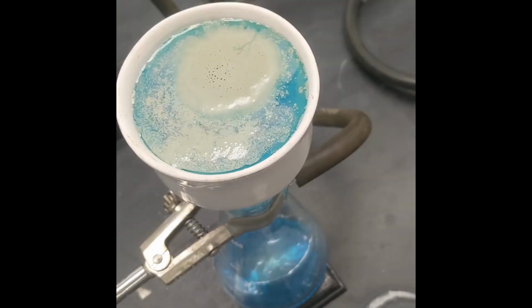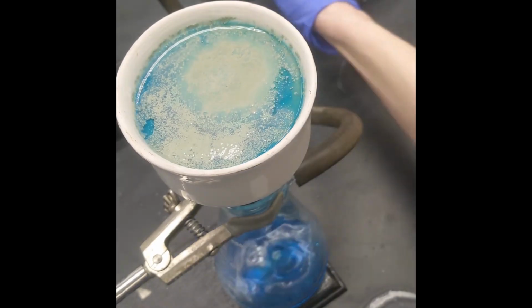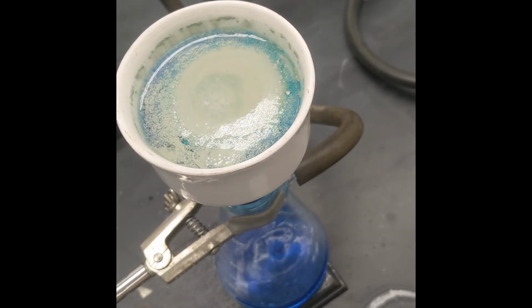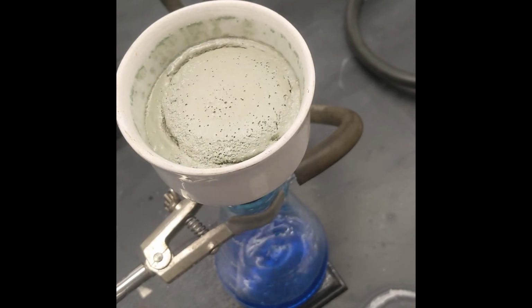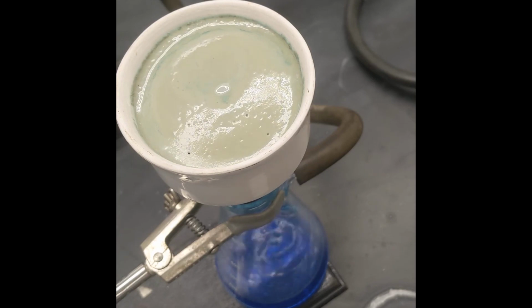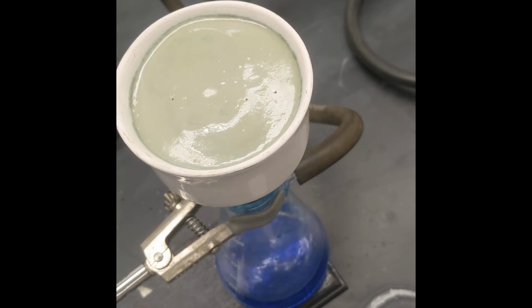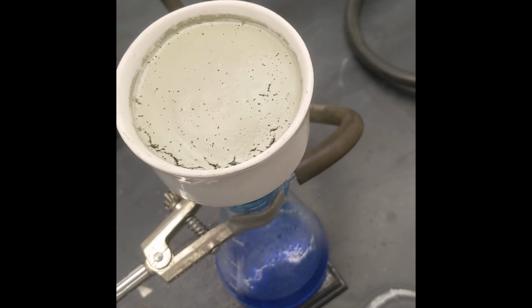I don't know how pleasant this stuff looks to work with, but it's not very. It is goopy, and it is thick, and it is nasty, and it's still got nitric acid on it, so yeah, you don't want to get it on anything. But it does get on everything, and I'm kind of surprised that my yield was as good as it is, because I made such a mess, and I cleaned it up, and I made a mess, and I cleaned it up. I can show you a couple of pictures, but it just won't do it justice. I made such a mess.